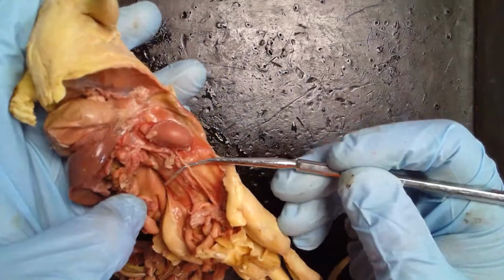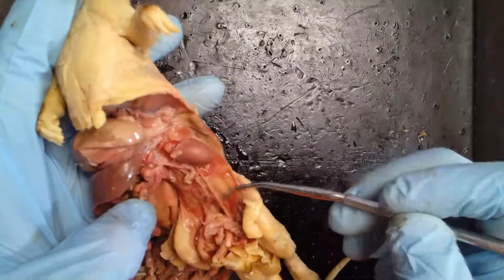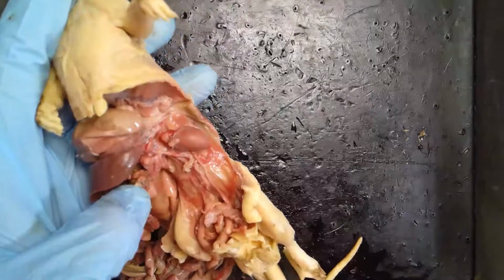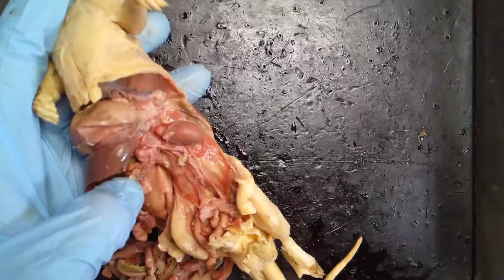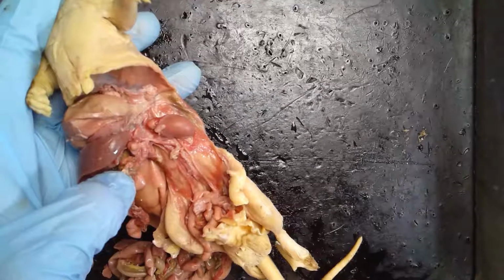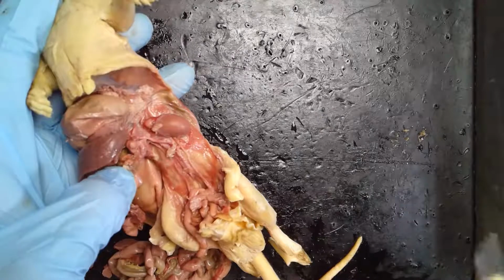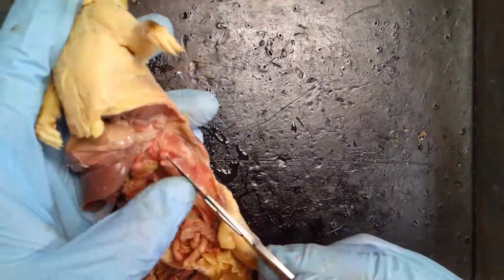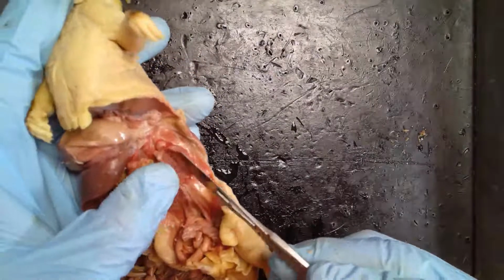So the urine is produced in the kidney. It's going to travel down to the bladder where it's stored, and then eventually it will leave. So the instructions tell us that we should cut into the kidney. Where does it say this? With the scalpel, yeah, it says cut into it, so we'll go ahead and cut into this one on this side. And we're supposed to look for the internal structure. It's tiny. Yeah, let's go ahead and do that.